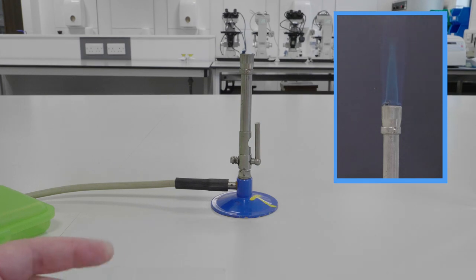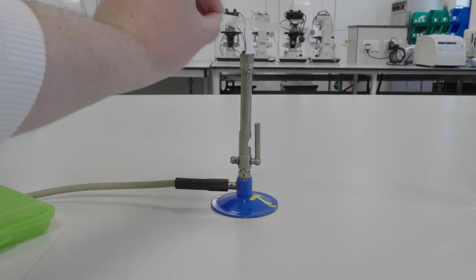Engage the blue flame of your Bunsen burner and pass your slide through the flame several times to remove any grease.